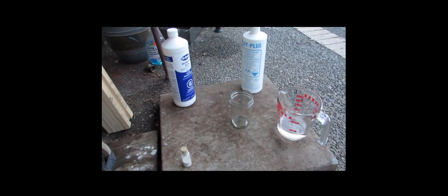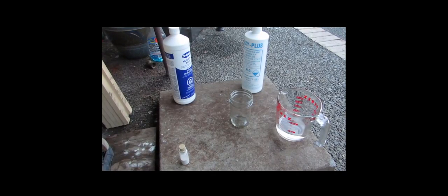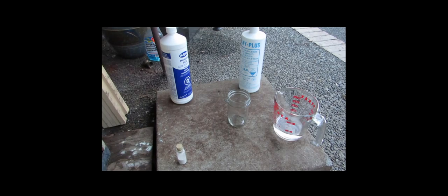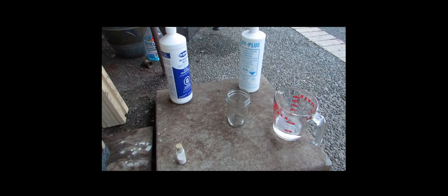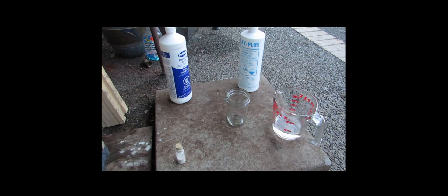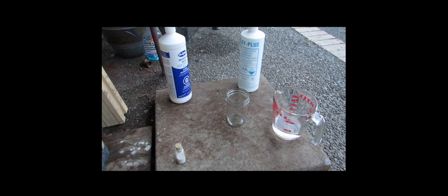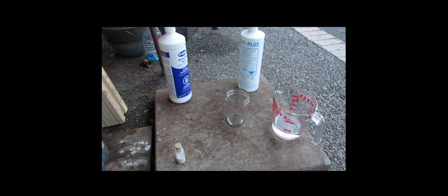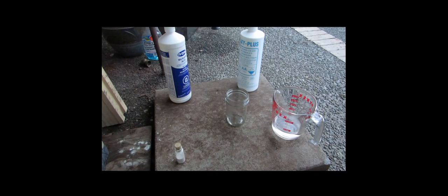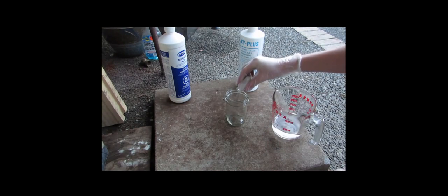Okay, so you can see that right there, I've scraped off all the potassium iodide off of the pot and stuck it in that small vial. So what I'm planning to do is measure out half of that into this canning jar, add a bit of water until it dissolves, and then add the hydrochloric acid and then a bit of hydrogen peroxide.